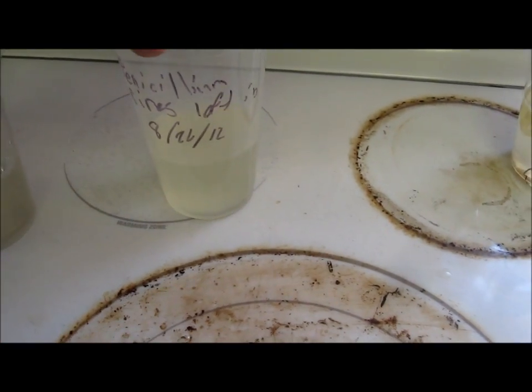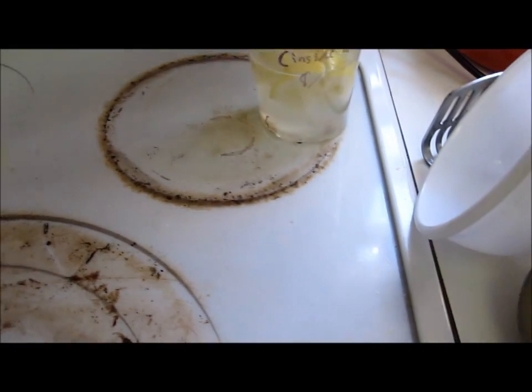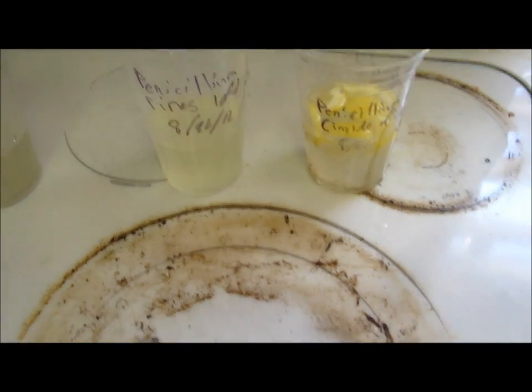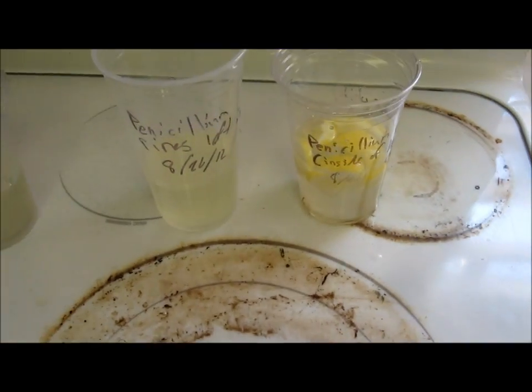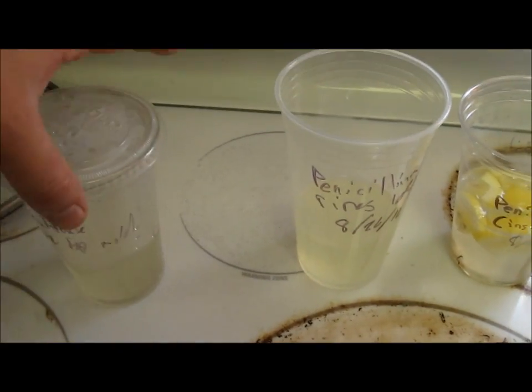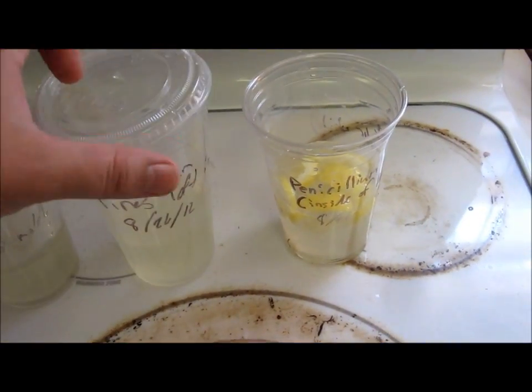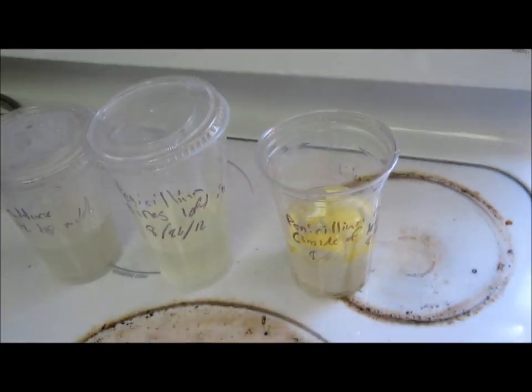Labeled these incorrectly, going to have to switch those labels around. I poured the ones with the rinds into the wrong one, but that aside.